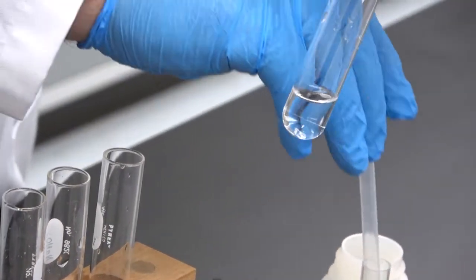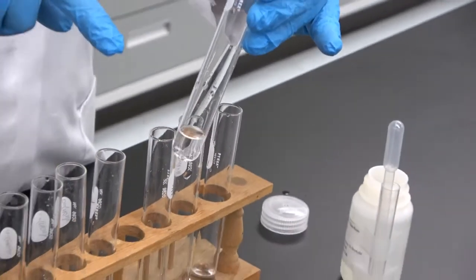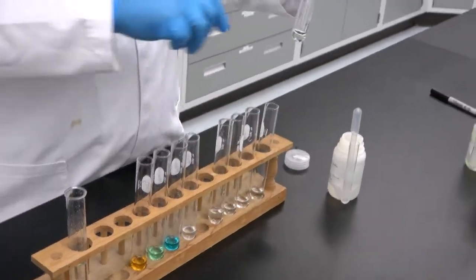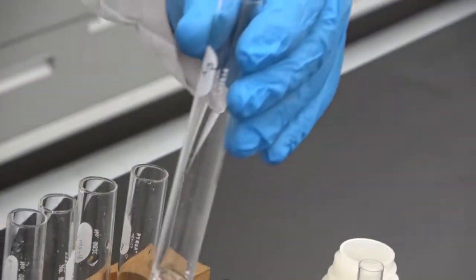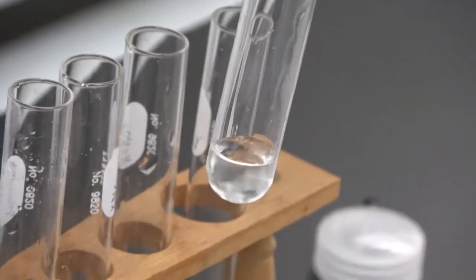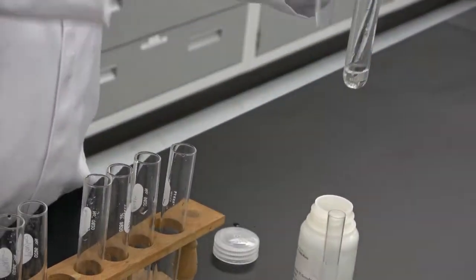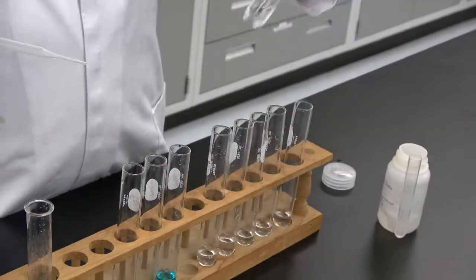This one, we're going to have it here settling for a little while and we will come back again to calcium, okay? Next one, strontium. We'll do the same in the case of strontium. Now comes barium.